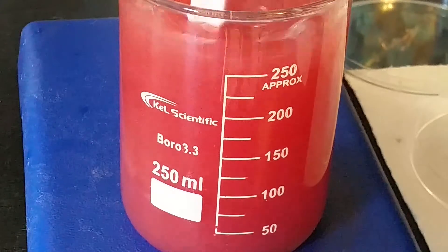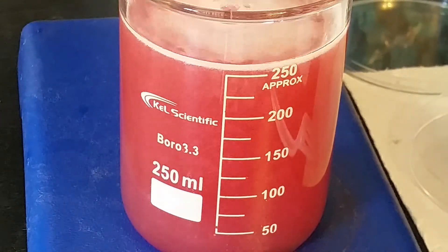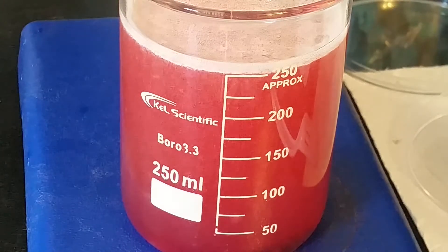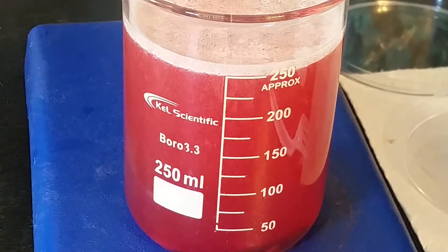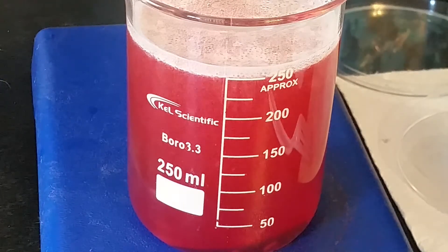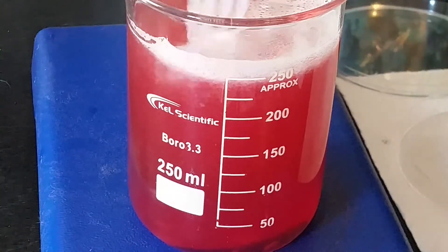So we're going to mix this up, and then we're going to let everything float to the top. This goop on top is the DNA. We're going to let it settle a little bit more.